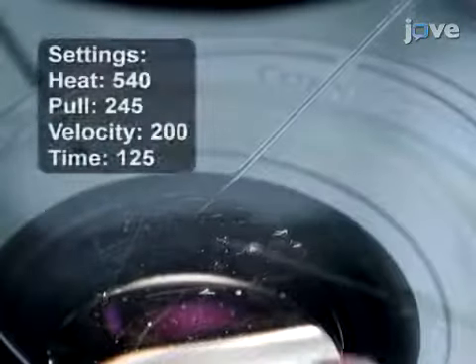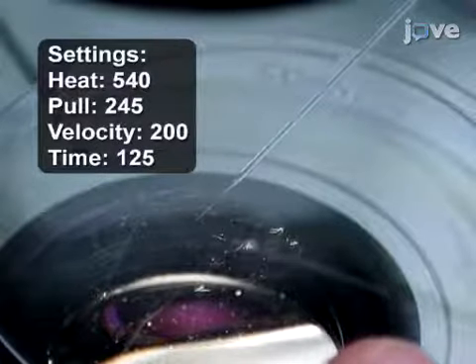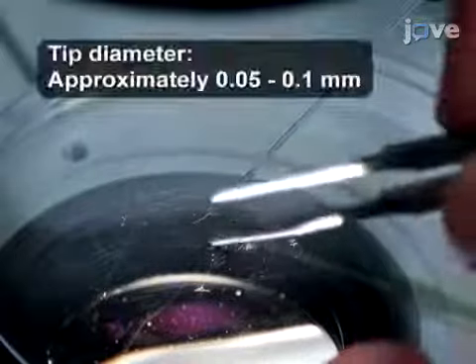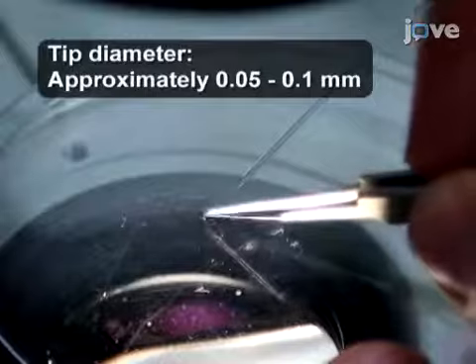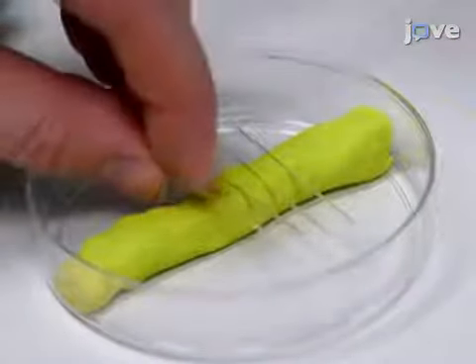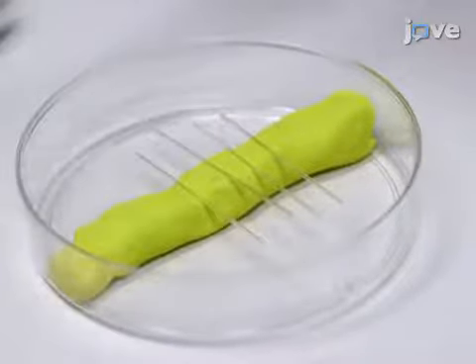Next, prepare some fine-tapered microinjection needles by pulling the fire-polished borosilicate glasses with filament using a pipette puller. Then, use a razor blade or fine forceps edge to cut the needle tips to create sharp angular injection tips. Subsequently, place the needles on a strip of modeling clay in a petri dish to protect the needle tips.